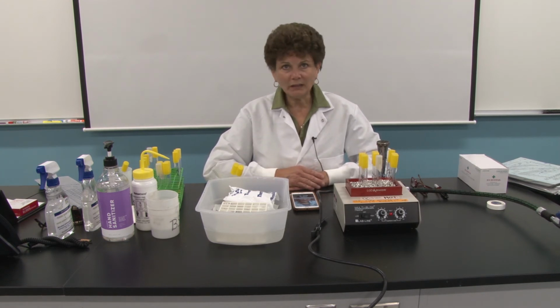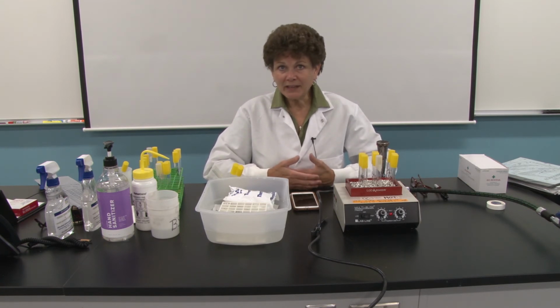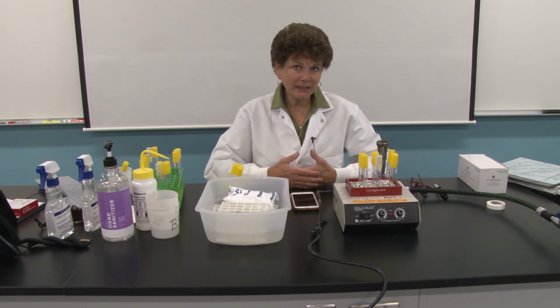I'm sure you all have relied upon boiling at home to sterilize things like dinner plates or dirty laundry, or maybe baby bottles and the nipples that go with baby bottles. We like to think that if we boil those, we are actually sterilizing them, but are we, in fact? We'll find out.